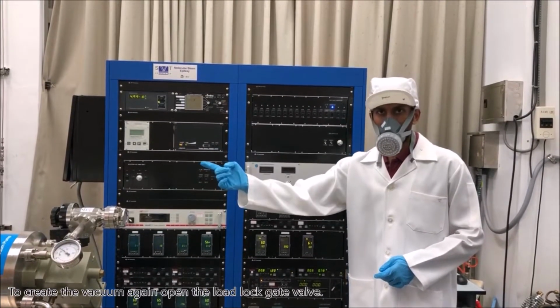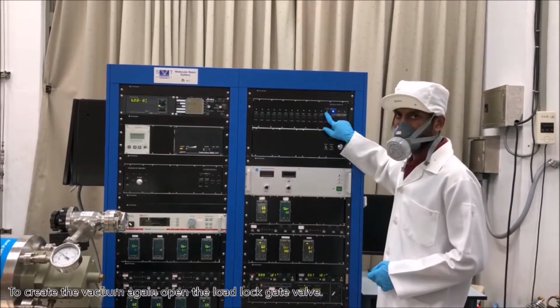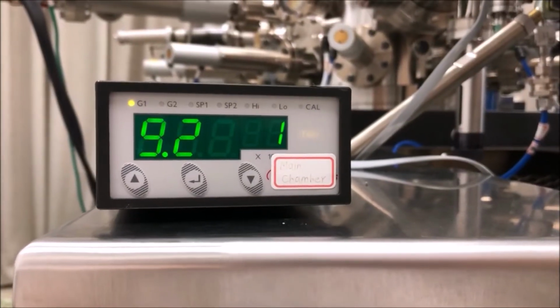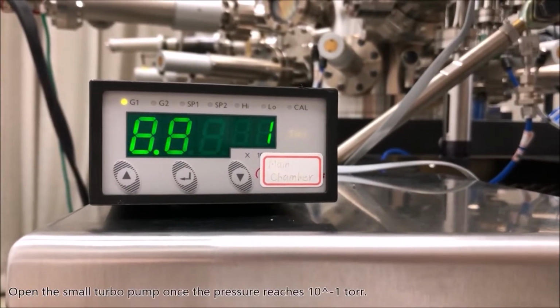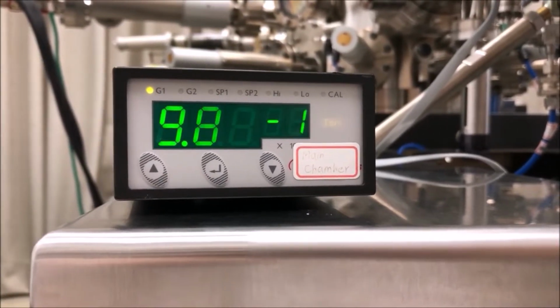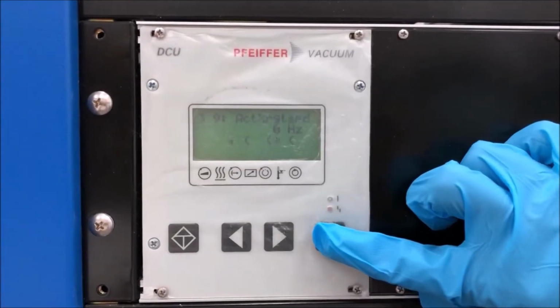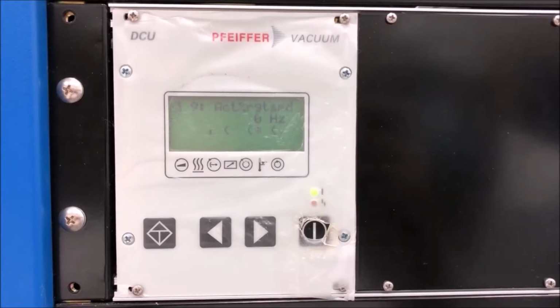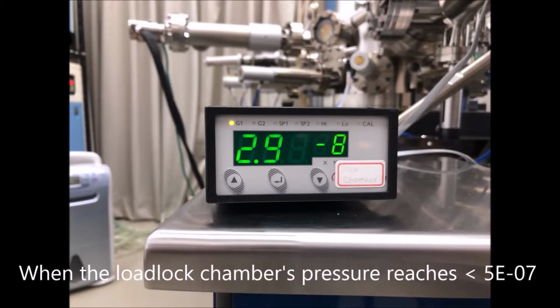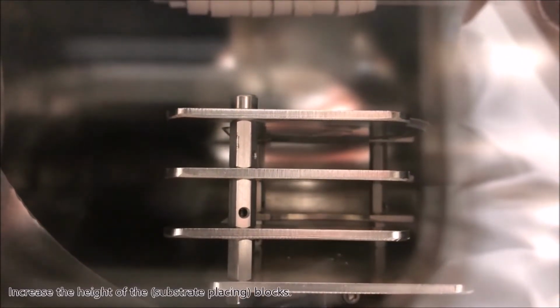To create the vacuum again, open the load lock gate valve. Open the small turbo pump once the pressure reaches 10⁻¹. When the load lock chamber's pressure reaches less than 5 times 10⁻⁷, we can load the substrate into the growth chamber. Increase the height of the blocks.